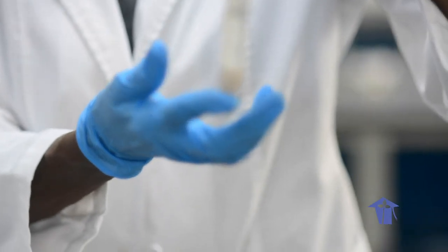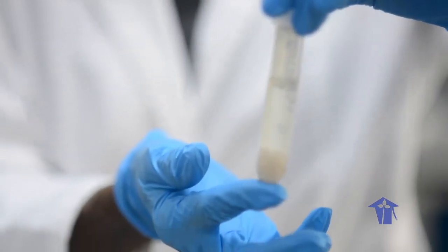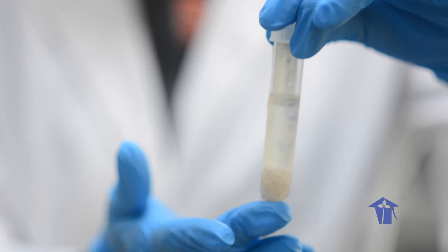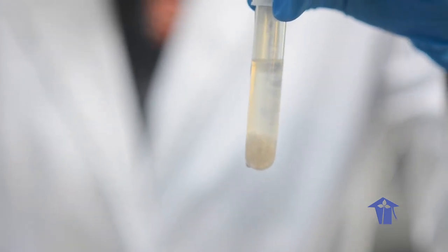In this tube, I have extracted my DNA and I have put it in this tube. So, you can see that this cloudy white mass at the bottom of the tube. And this brings us to the end of this demonstration lab for extracting DNA from banana.